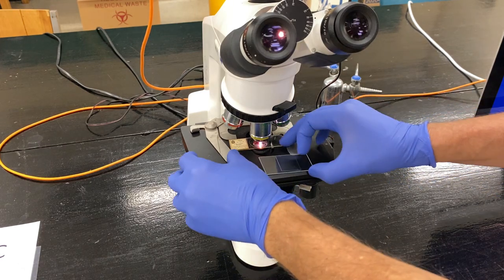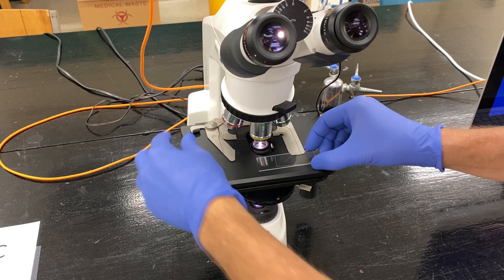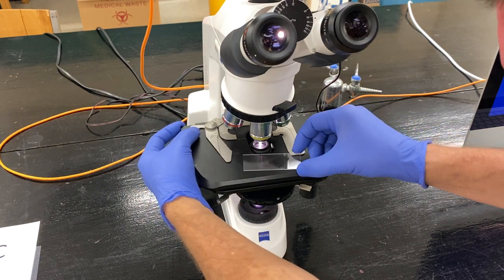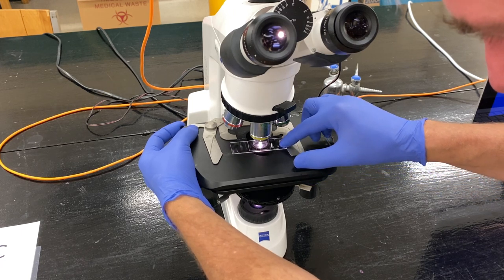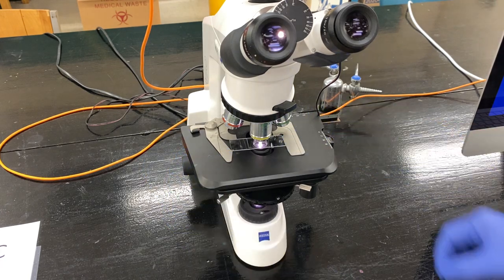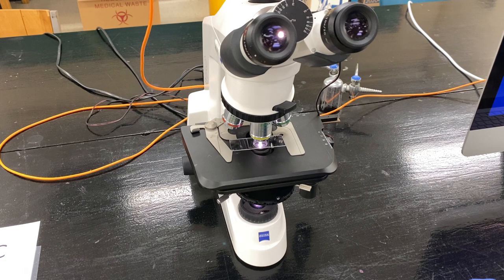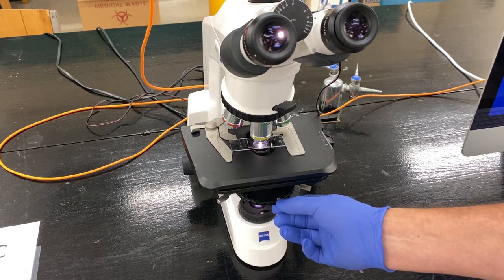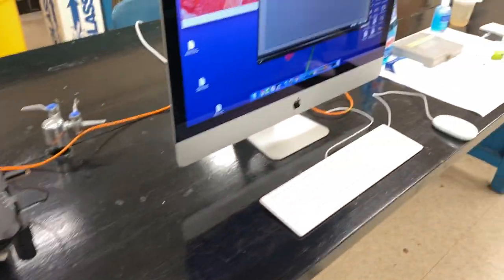Now I'm going to take off the prepared slide and replace it with the plankton slide by moving the spring lever on the slide holder, sliding the sample in place, then releasing the slide holder until it's fastened to the stage. The microscope is set for brightfield, so I'll look at the image with brightfield microscopy first.